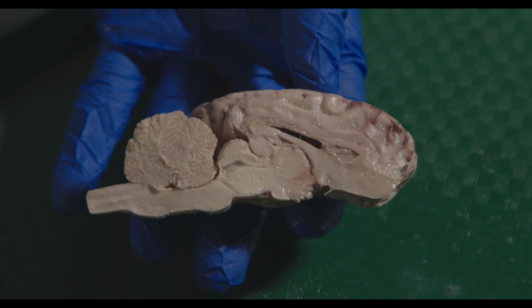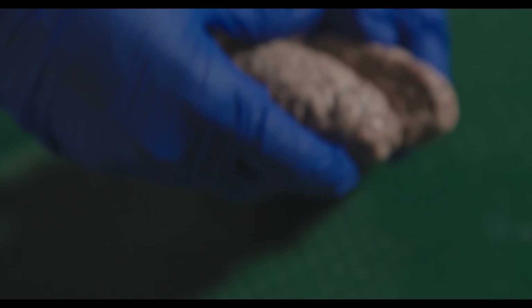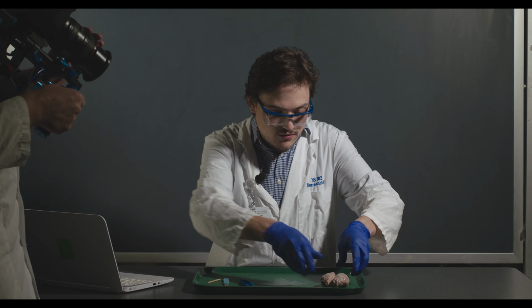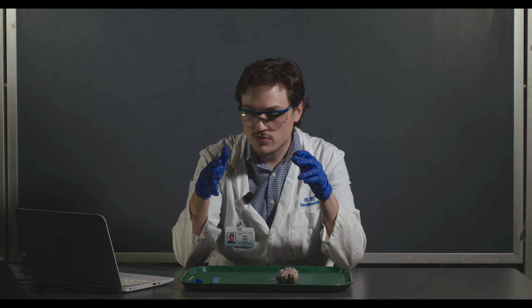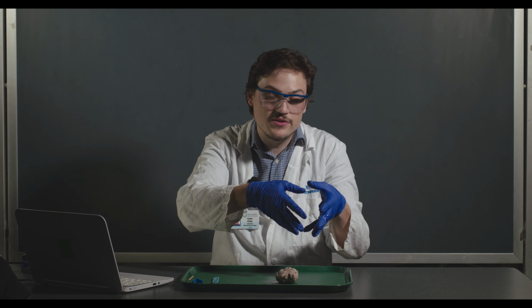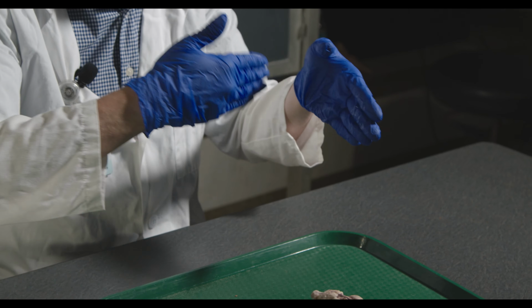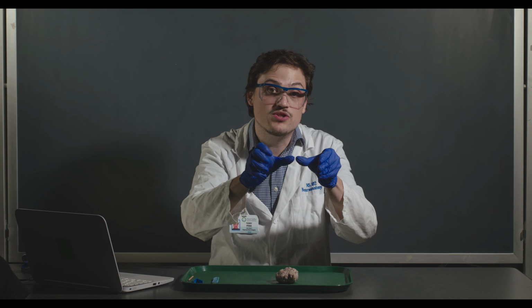Okay, so now we're going to try and make some coronal cuts. So I'm going to get a fresh one really quick. Usually when we have everyone here in the laboratory, if you've already made your mid-sagittal cut, you can just take one of the hemispheres, and this is described in the lab manual. You can just take one of the hemispheres and do these cuts and then fold the tissue back, and you should be able to see a mirror image on either side.